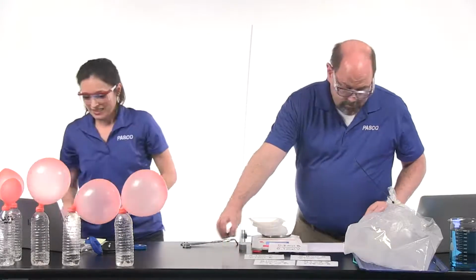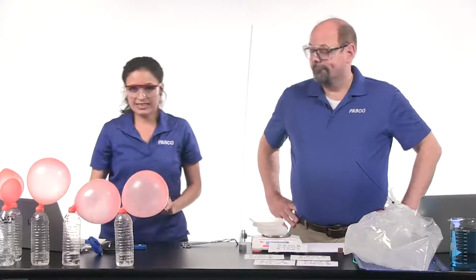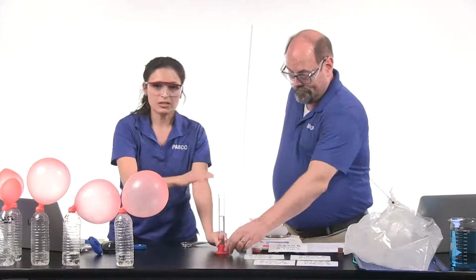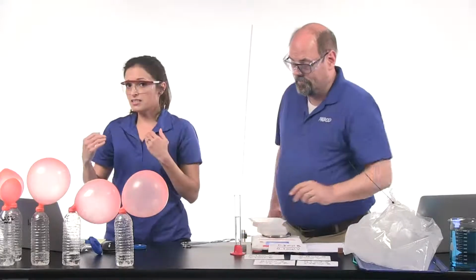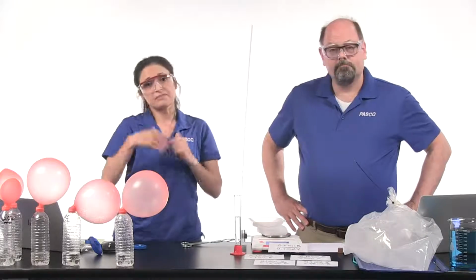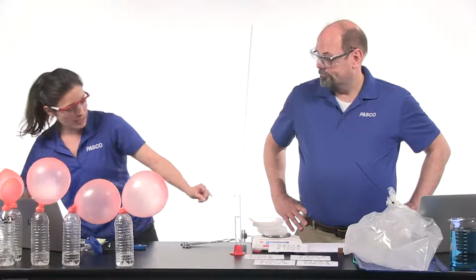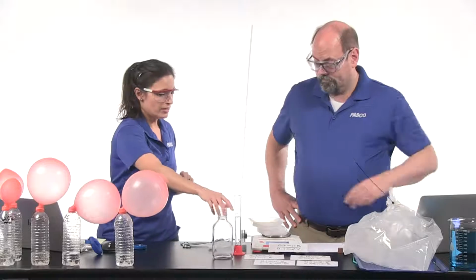Okay, now this experiment is found in the Essential Chemistry lab book as well as the Essential Chemistry textbook. It takes some baking soda, this time in solution, and this time students are the ones who are going to figure out the moles. We don't just give them the moles; we give them grams, and we give them molarity, and they have to determine the moles from there. So we've got 40 milliliters of sodium bicarbonate. Go ahead and pour that into the reaction.